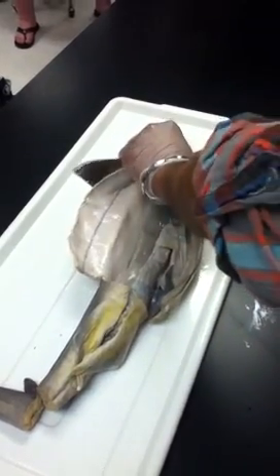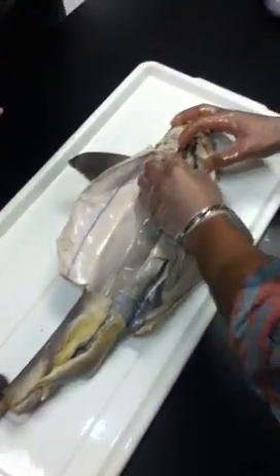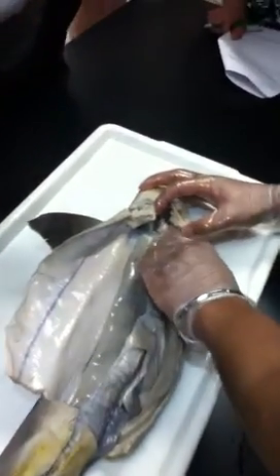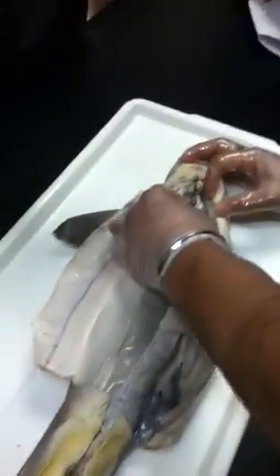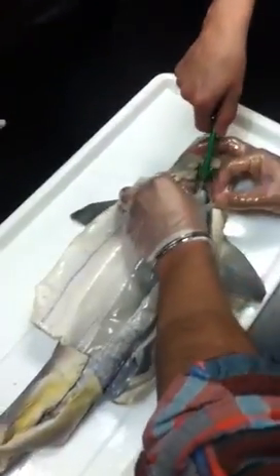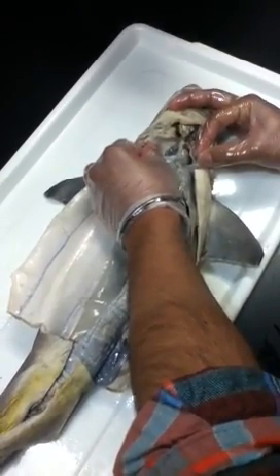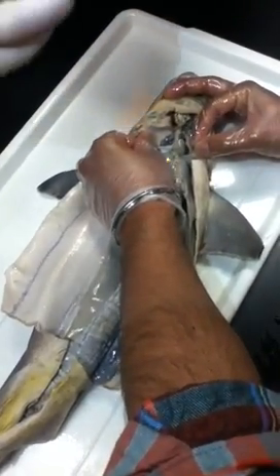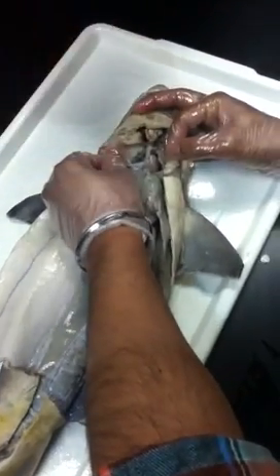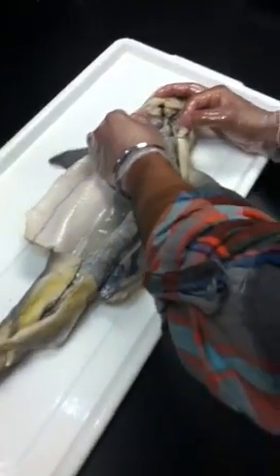And there's one more thing, the heart. This is the ventricle, the really hard looking thing. The lighter part, and then the atrium is on the side. It's important to check out this heart because it might not be what you expect. It looks like there's two, but it's actually just one. It's a two-chamber heart. The central chamber is the ventricle. Surrounding that is the atrium. So it looks like there's an atrium on each side. But remember, how many chambers does the shark heart have? Two. One ventricle, one atrium. So it's deceiving.